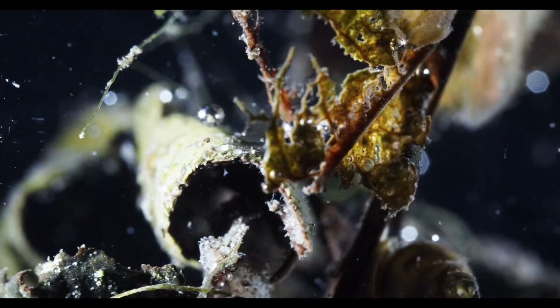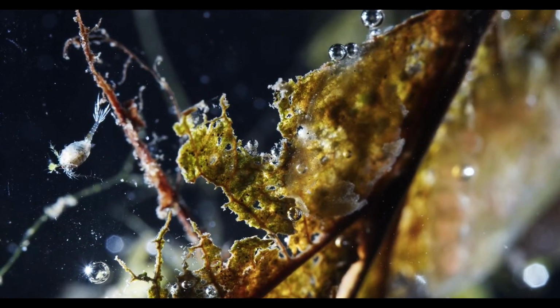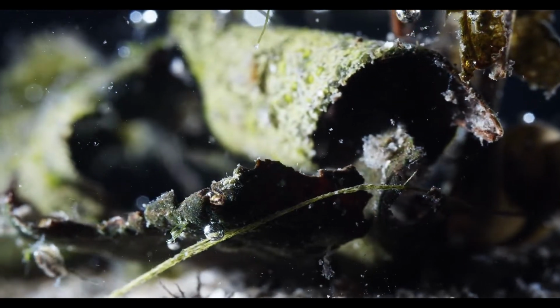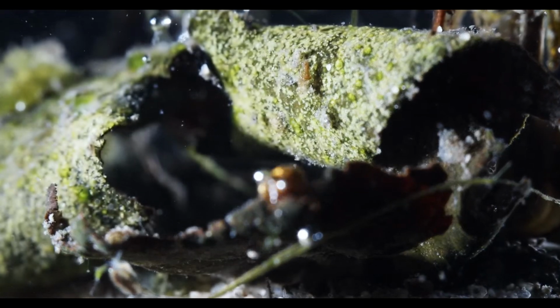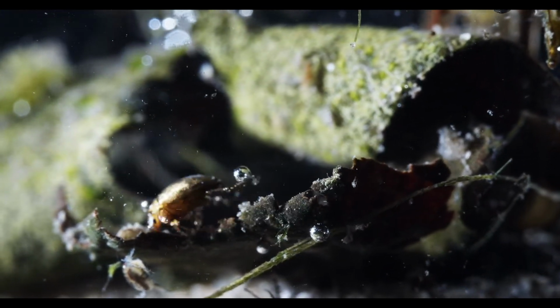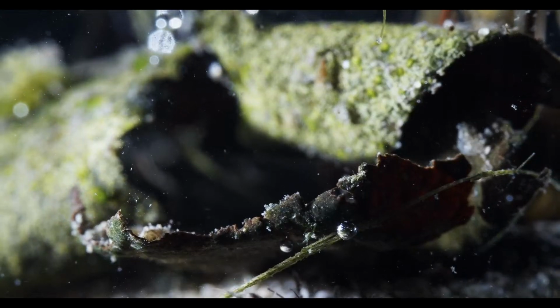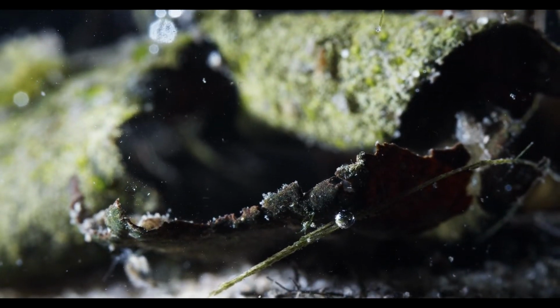And it has bladder snails and the same cladoceran. Ah, we see the beetle looks like he's licking the biofilm off the sleeve. Is he? If I could get him in focus, we'd know. And he's gone again. We saw kind of a worm here. A small annelid worm. One of the small white worms.